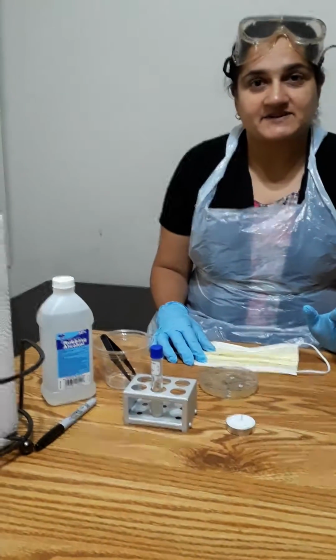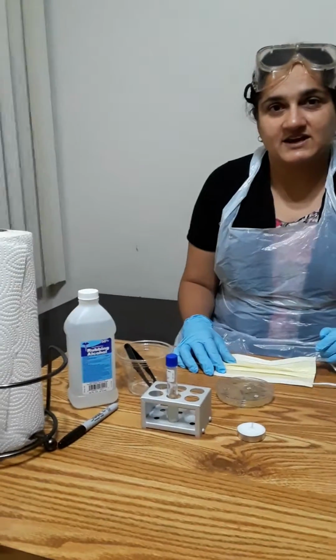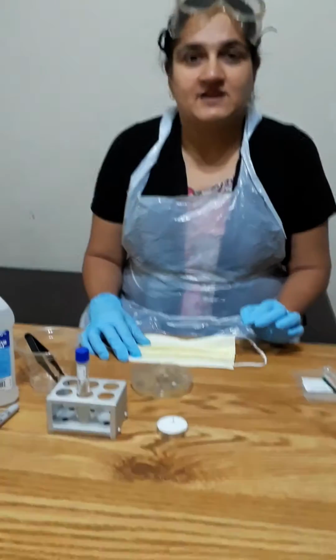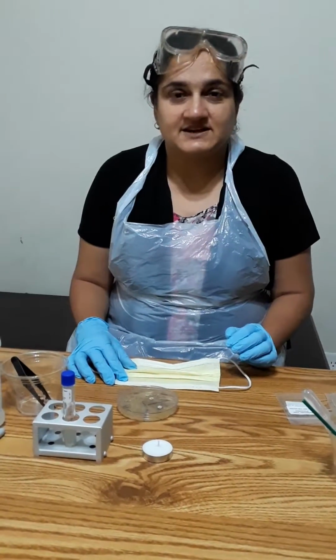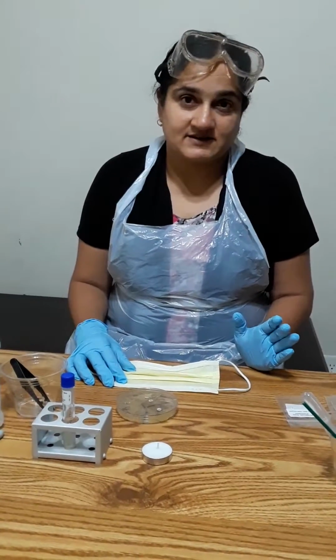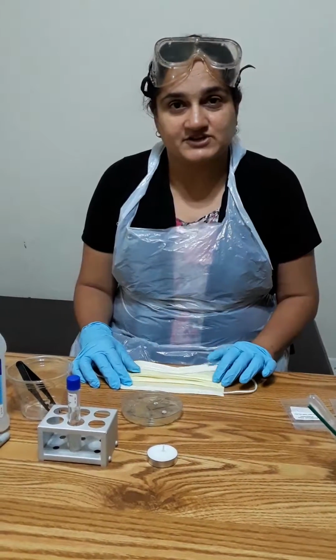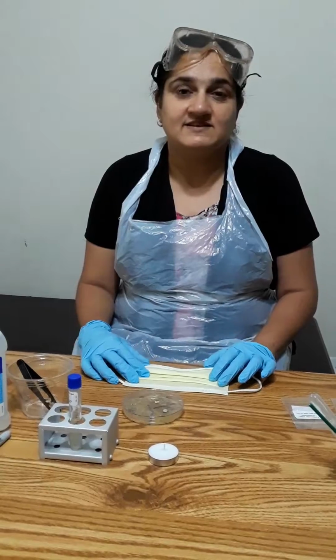The title of the lab experiment which I am going to perform today is antibiotic sensitivity, and that is the Kirby-Bauer diffusion testing. This experiment is related to my Bio 225 microbiology class, and this is week 7.